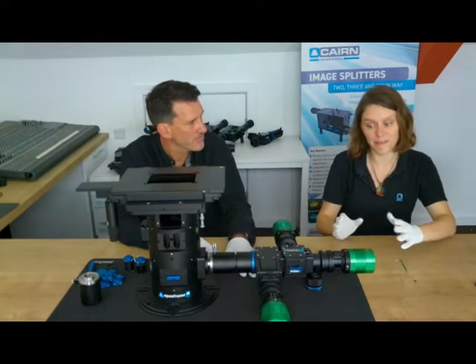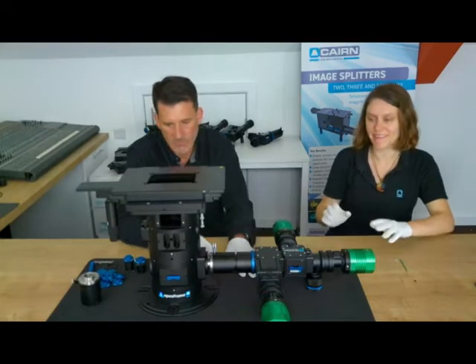We can move on to one of our more fancy cams now with some integrated wheels.